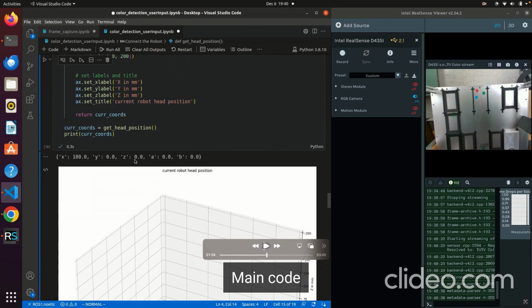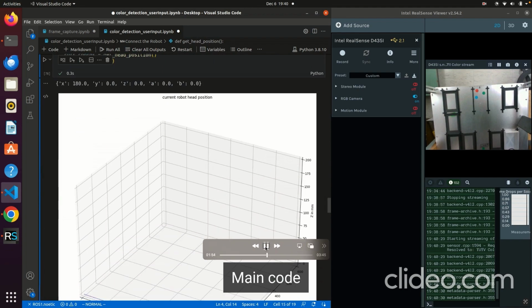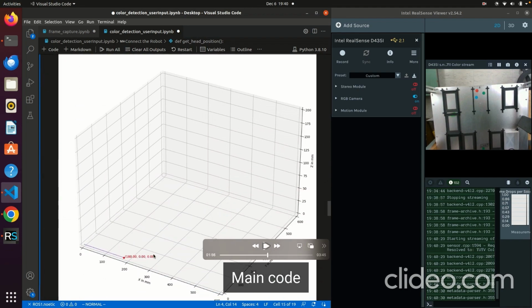As you can see, the x, y, and z values are all zeros except the x, because x is here, so you can see the robot is currently homed. It's not anywhere else. So x, y, and z. So this is a simulation.